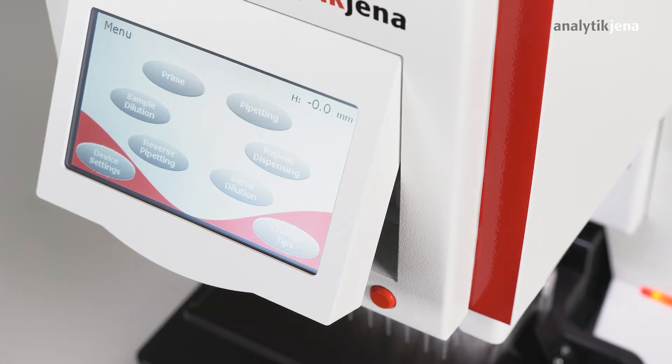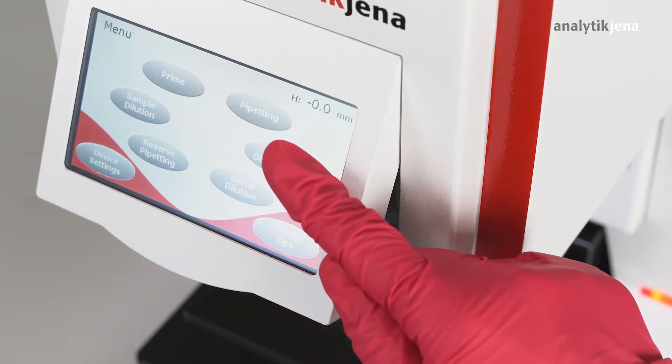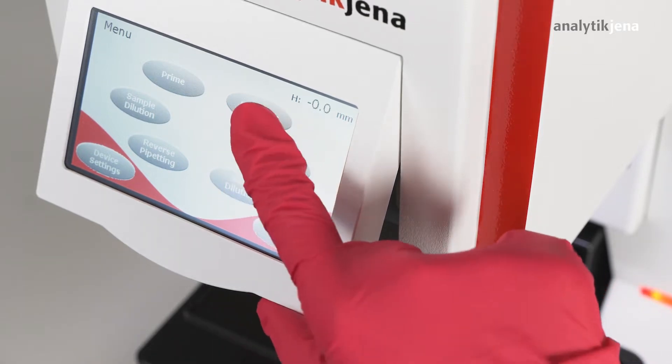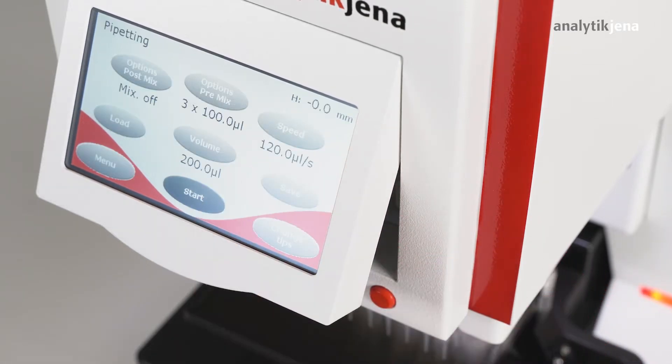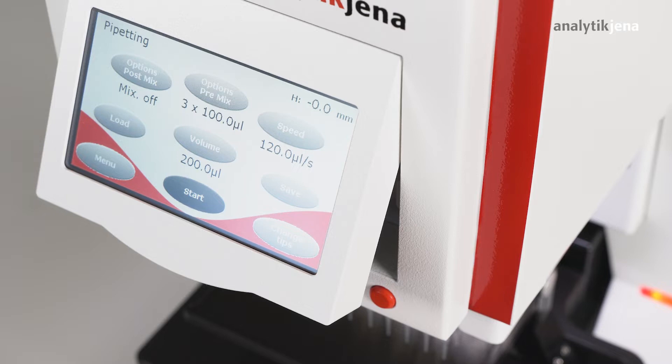The Pipetting Mode 'Pipetting' will be used for the demonstration. The Pipetting Mode allows you to choose between the following options: post-mix options, pre-mix options, volume, and speed.